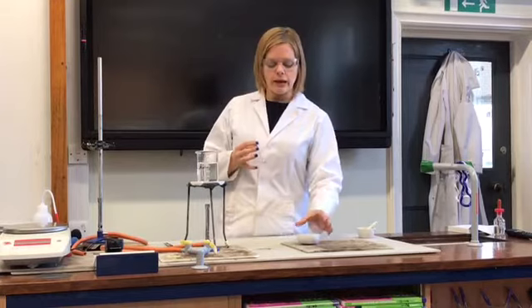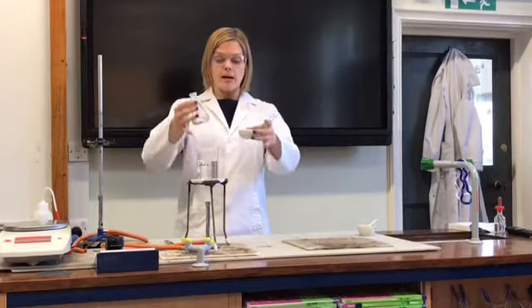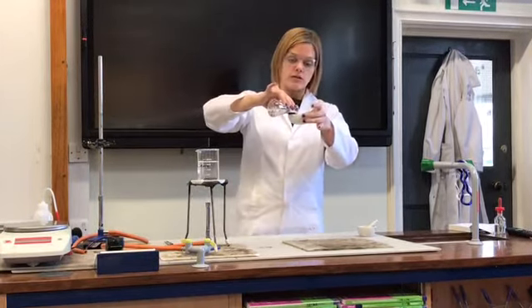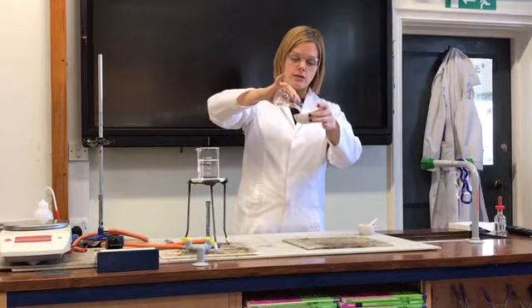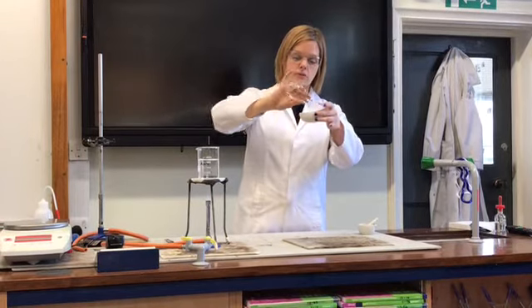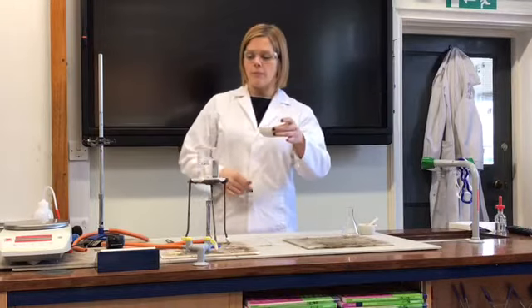Now what I've got here is an evaporating basin, and I'm just going to pour some of that filtrate containing the sodium chloride into that evaporating basin. So I've got some sodium chloride solution inside this evaporating basin.